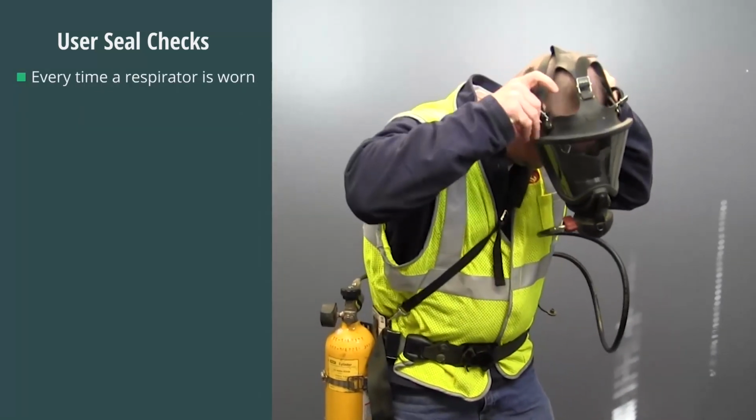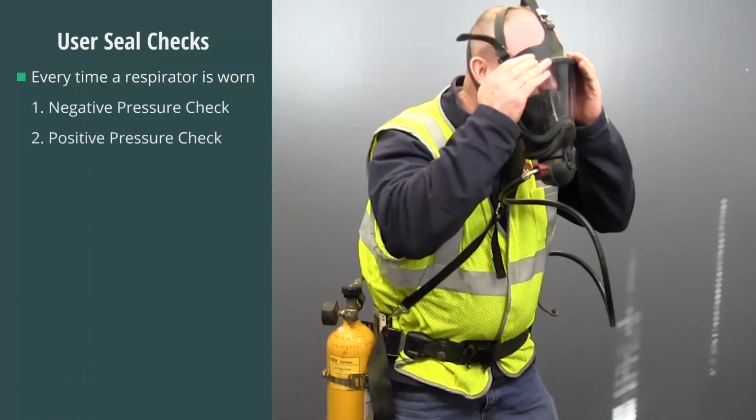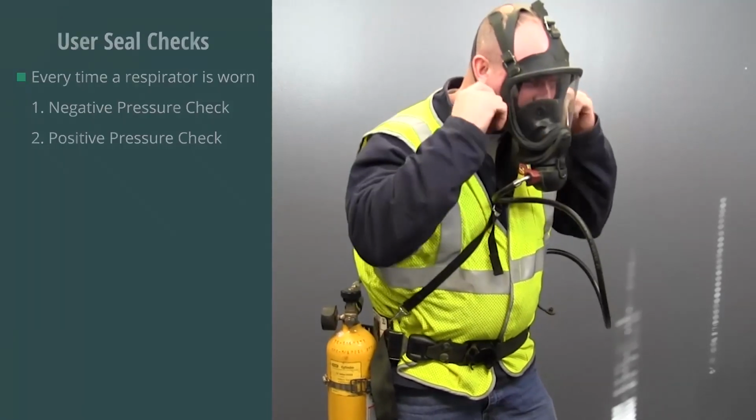To achieve a proper face-to-mask piece seal every time a respirator is worn, a user seal check must be performed before entering a hazardous atmosphere. This check is conducted by the wearer in two different ways. The first is called the negative pressure check.